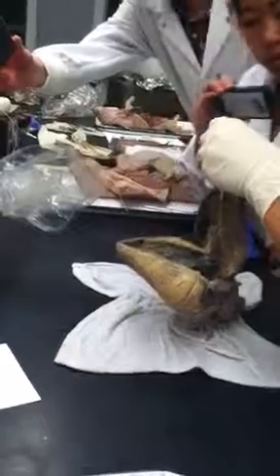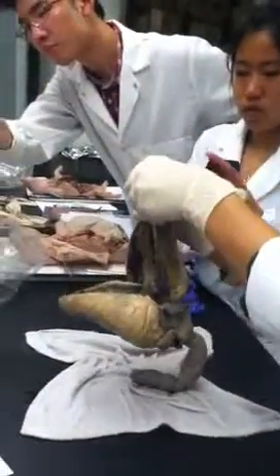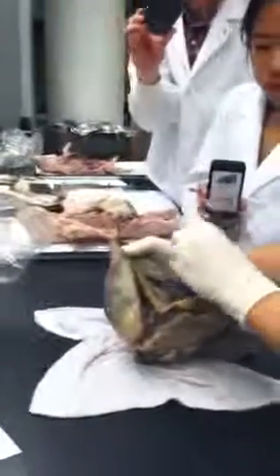I'll turn it around so you guys can see. Does everyone see that? Is it on the right thing? No, I don't see it. A little. Yeah. Oh, it goes up the middle, kind of? Yeah, it's like right down. Okay. Got it? You see it now? I'll show you this. This is a semilunar valve.